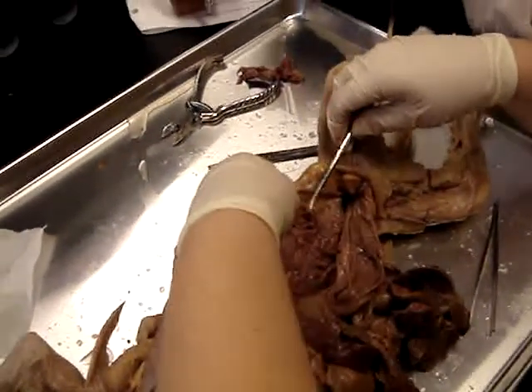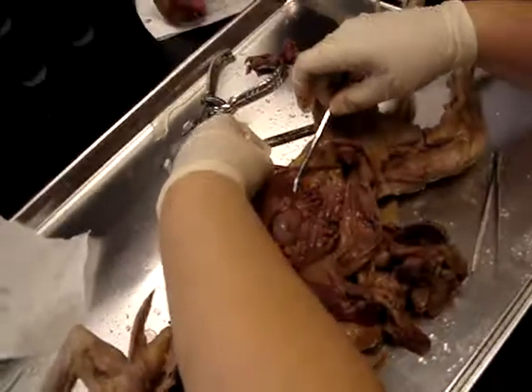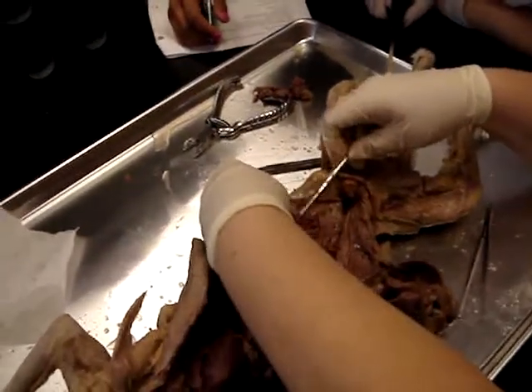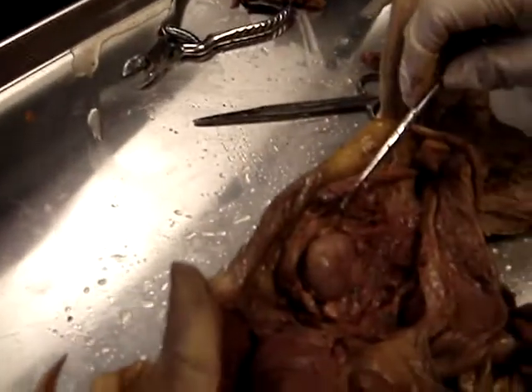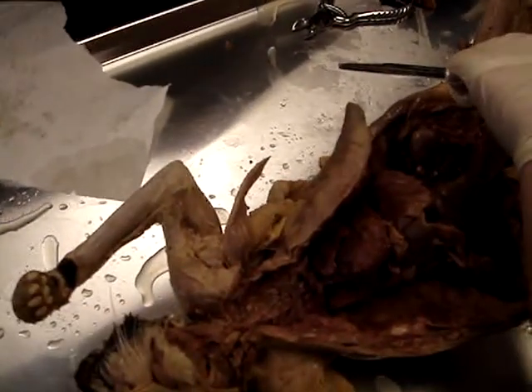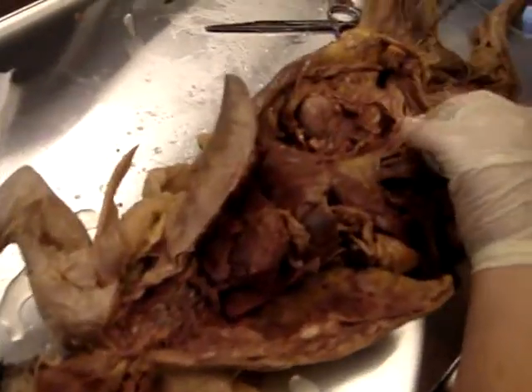All right. And they're not injected very well, so you can't see it very well, but this little tiny thing that I'm holding, it's not injected, is the gonadal artery or the ovarian artery. Remember, gonadal is a generic term. So this is the ovarian artery. Then we have the inferior mesenteric artery, which attaches to the large intestine. So that's the inferior mesenteric artery right here.